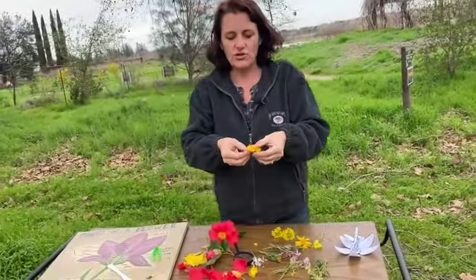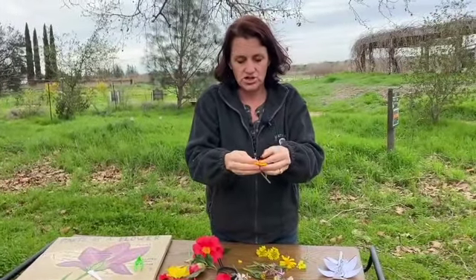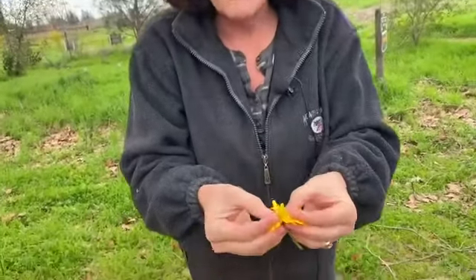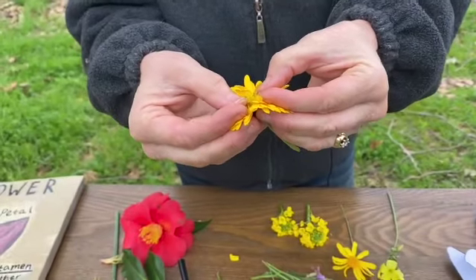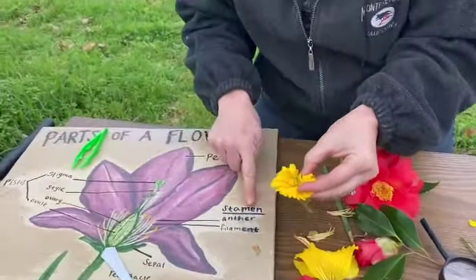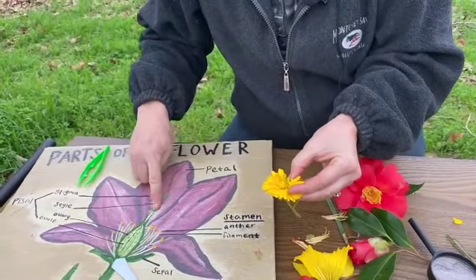I am going to tell you that flowers that have a lot of petals like this can be a bit challenging to do, because in the center, look at, they have so many different pieces hidden. So we're going to, again, if we compare it over here, remember the stamen are the outside pieces. In the middle is that stigma.